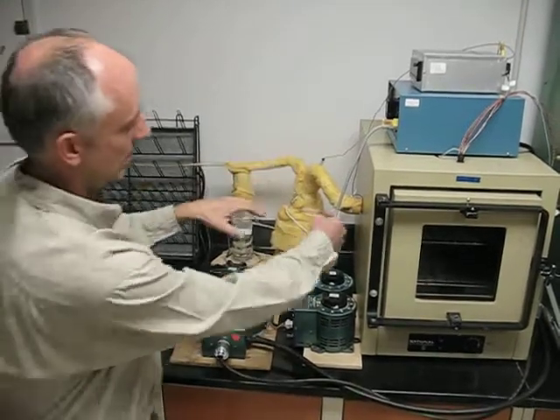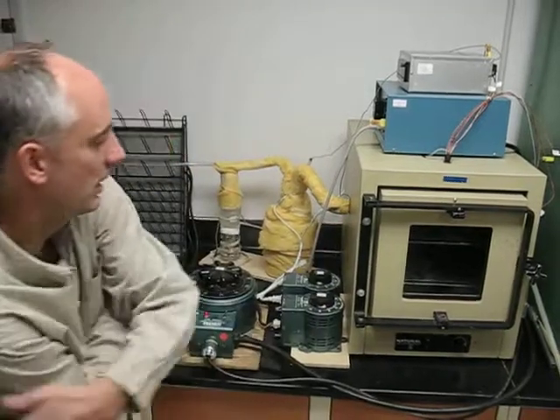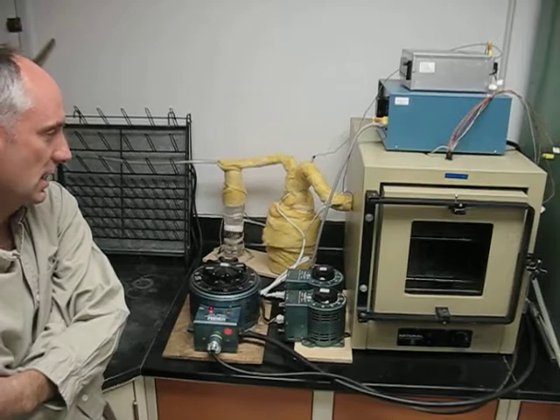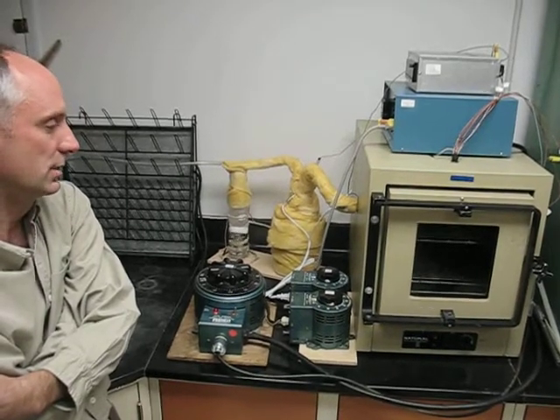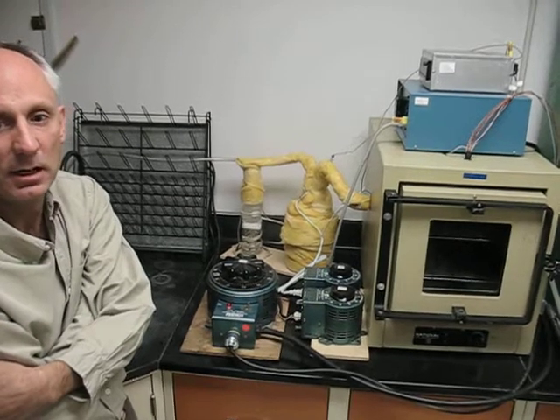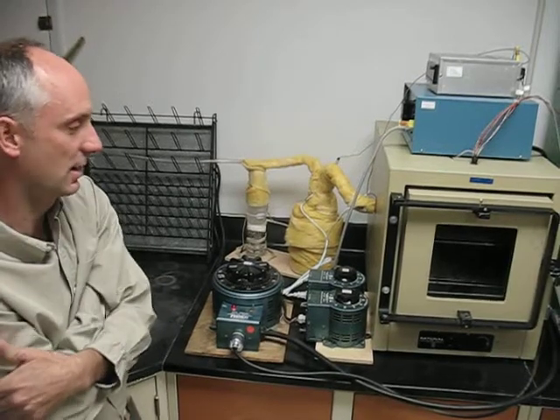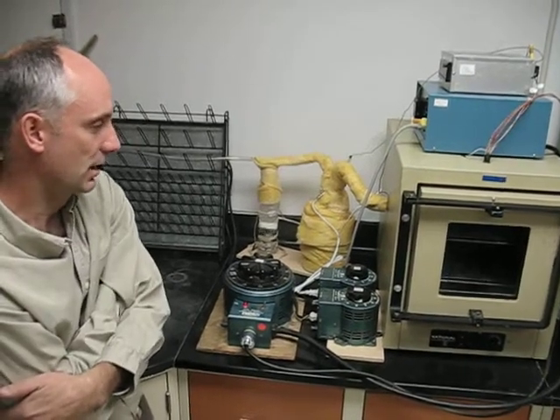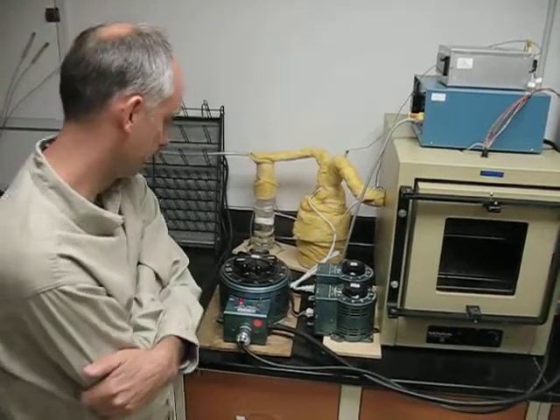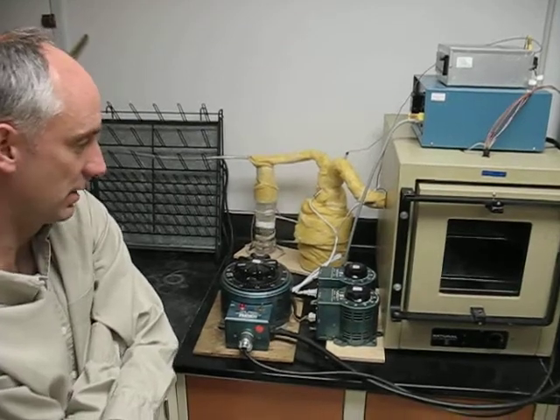We've measured the air exit right at the exit from here, and it's on the order of 47 degrees C. So it's entering the oven within 5 degrees C of our desired temperature, which helps stabilize the oven temperature, because there's not a drastic temperature change and heating going on with the air that's entering it.